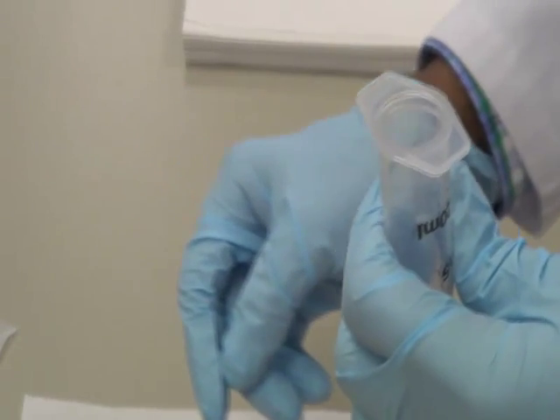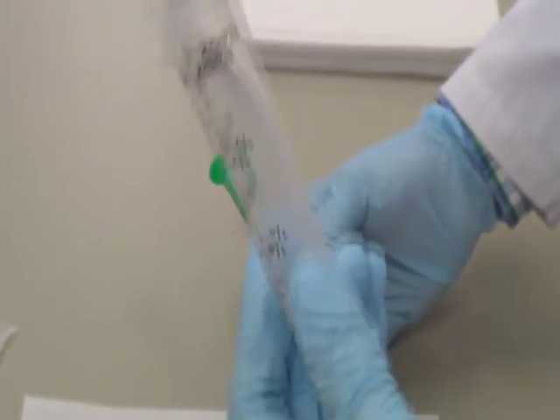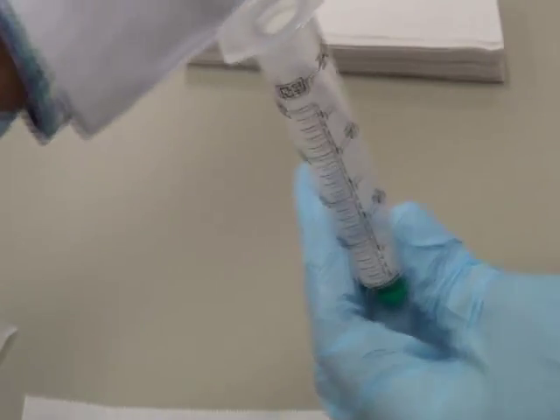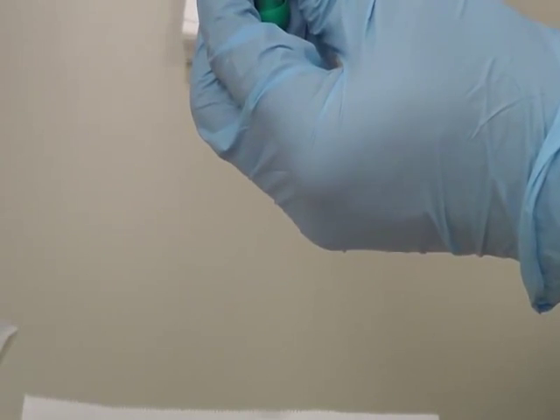And what we can do is we can directly add lecithin isopropyl palmitate, that is 4.5ml, dissolving the drug in ethoxidiglycol. I am adding the lecithin isopropyl palmitate. Again I am back-loading this.